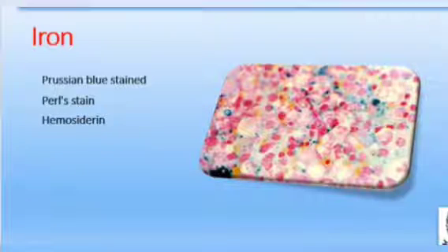Then, some bone marrow samples need special staining, like in iron deficiency anemia or iron storage diseases. We need iron stains, that is Prussian blue stain, also called Perls stain. Examine the Prussian blue stained smear first under low power for visible hemosiderin fragments; a slight color or a few granules are normally present. Note whether iron hemosiderin is increased or absent.